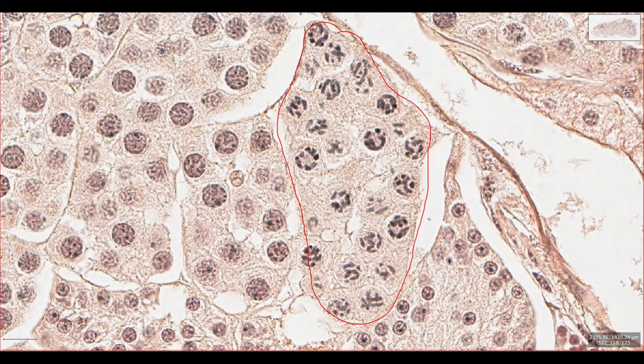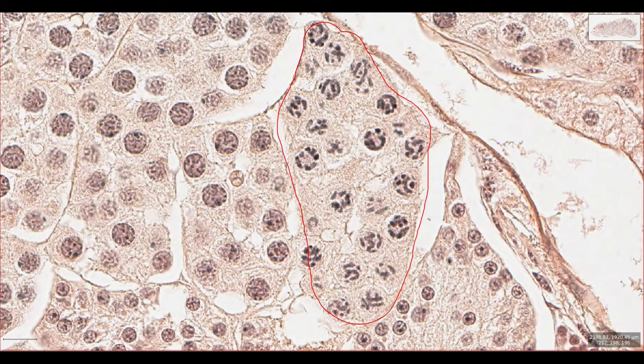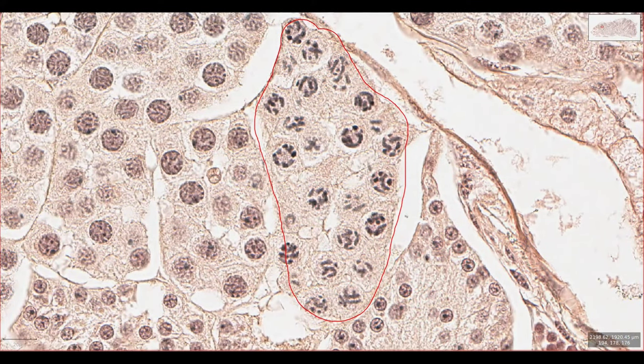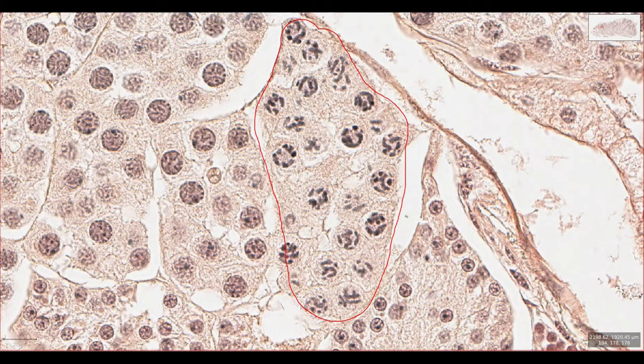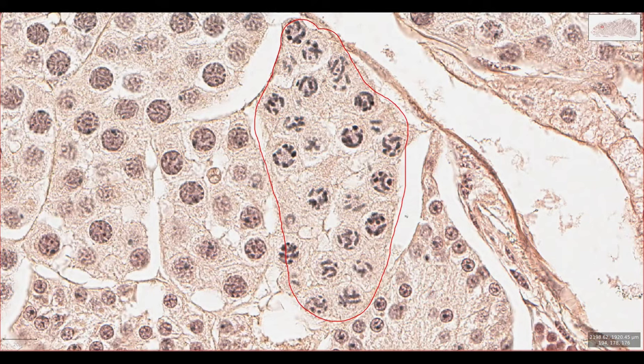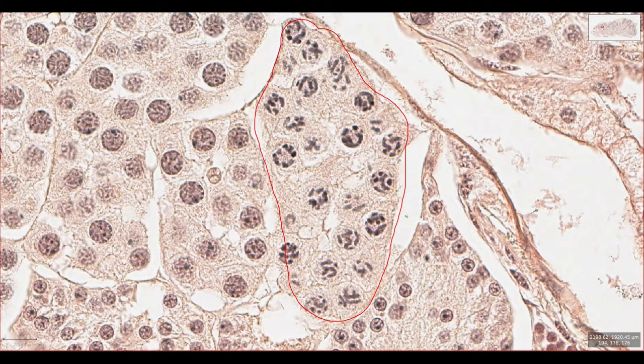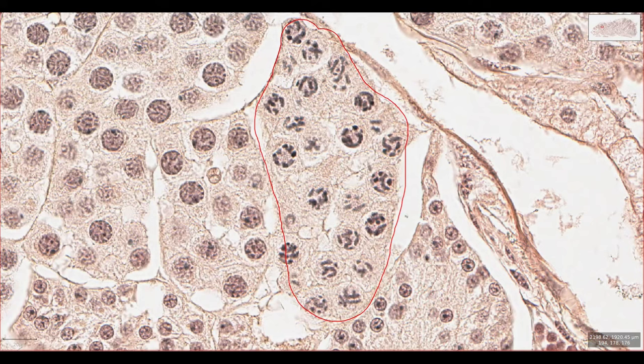These are cells in the process of mitosis, or cell division, as the spermatogonia replicate within their cyst. The number of times the spermatogonia replicates is dependent on the species — those of grasshoppers will undergo five to eight spermatogonial divisions. Once these divisions are complete, the spermatogonia mature to form spermatocytes.